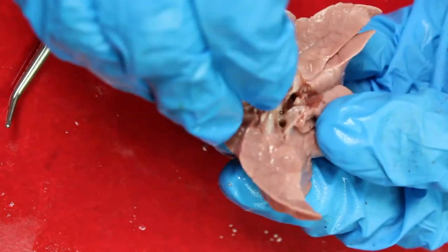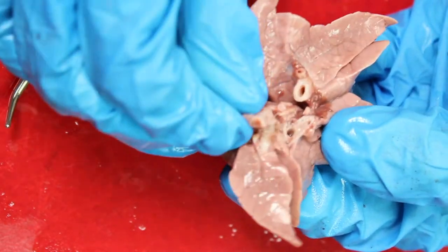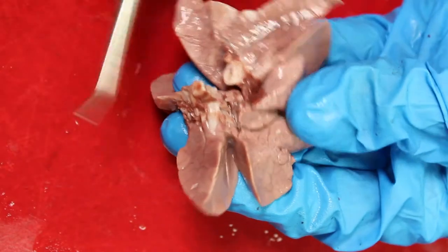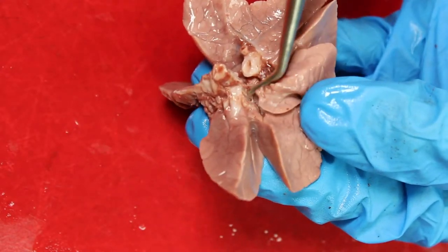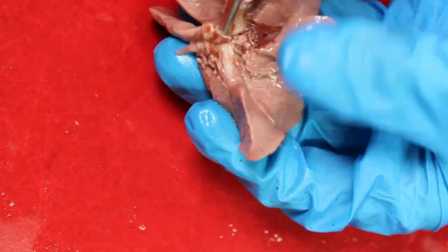The respiratory tract ends in lobules. Each lobule consists of a respiratory bronchiole, which branches into alveolar ducts and alveolar sacs, which in turn divide into alveoli.